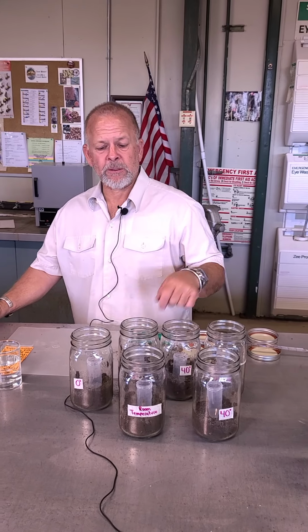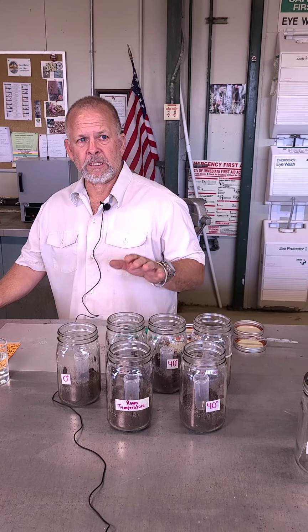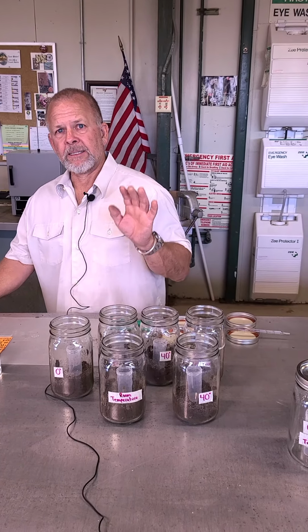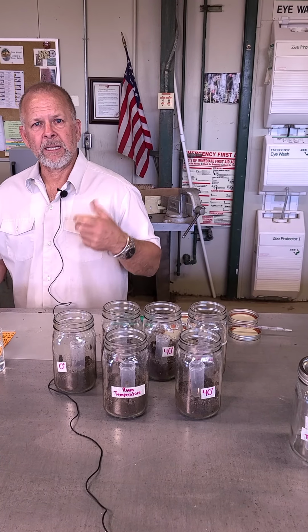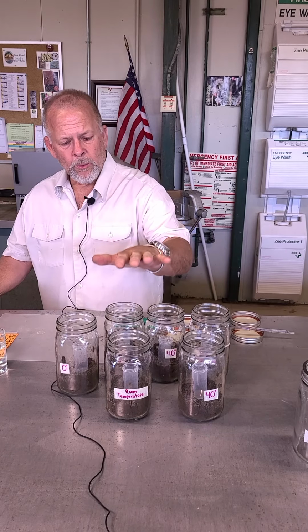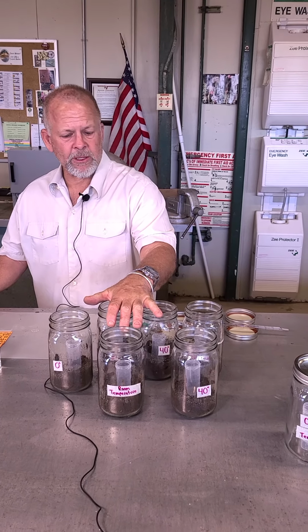That seemed to be perfect. We could mix it all up. The soil was obviously a nice damp consistency. We could have probably squeezed it together just barely in our hands. It probably would have quite crumbled. So we want to get these things sealed up pretty quick before they dry out.